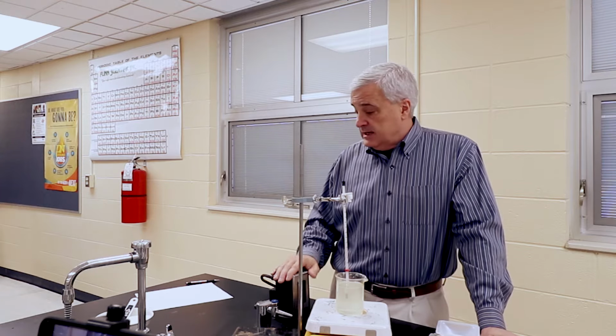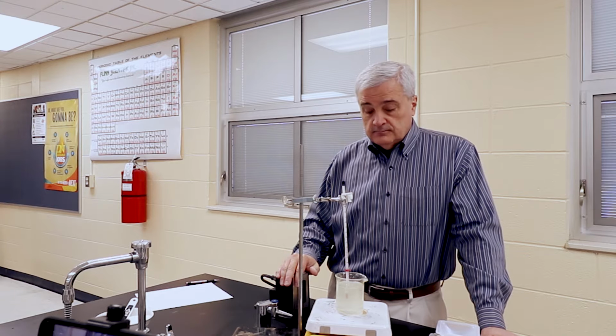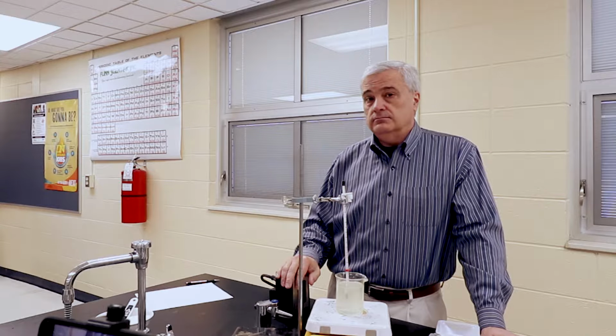We're gonna see if we can add some more. How much more can we add after the temperature rises? Or can we add more?